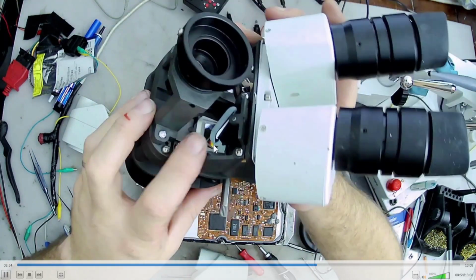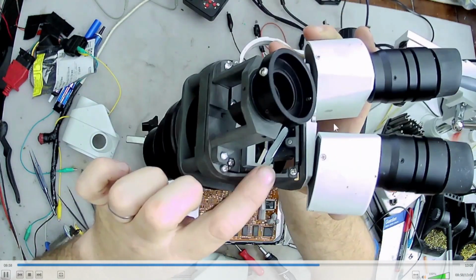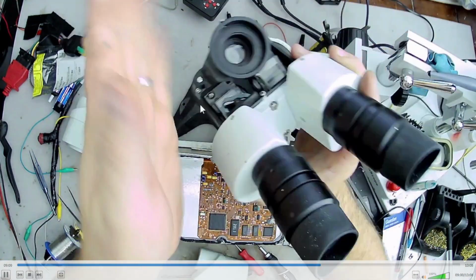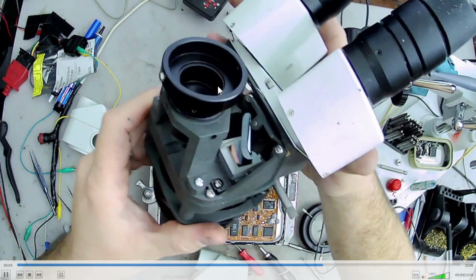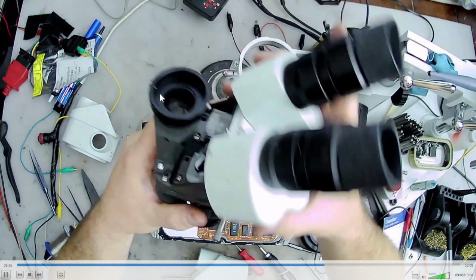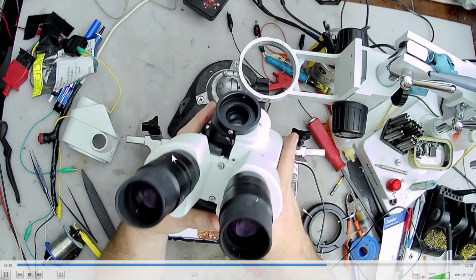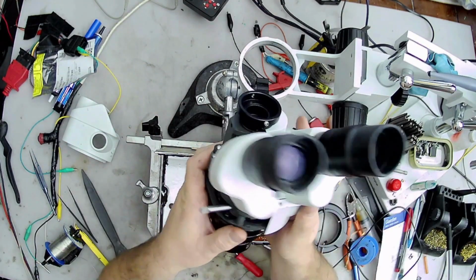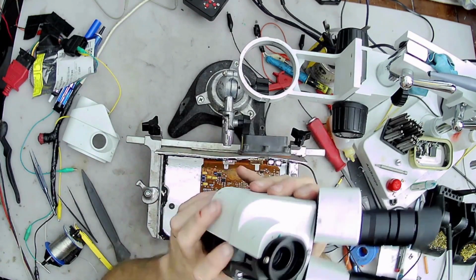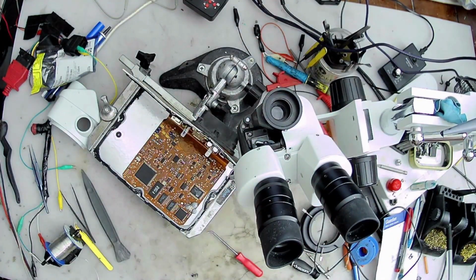Oh, here I'm talking about this thing, and you know, I have no idea about optics at all, so I don't want to pretend like I know anything. I was just saying how neat it was, and how you would expect this to be straight if you were just trying to wing it, but it's actually very angled. So you definitely want to put your camera on there to align it. You don't want to just try to guess at it. And it's very sensitive. You go just a hair to the left or just a hair to the right, and your picture is way off.